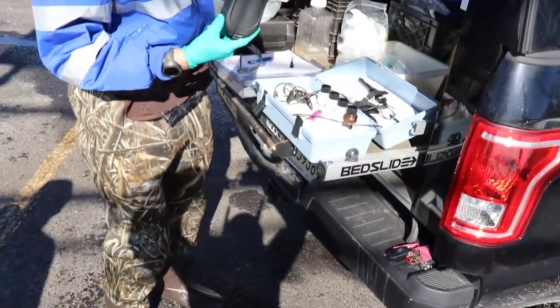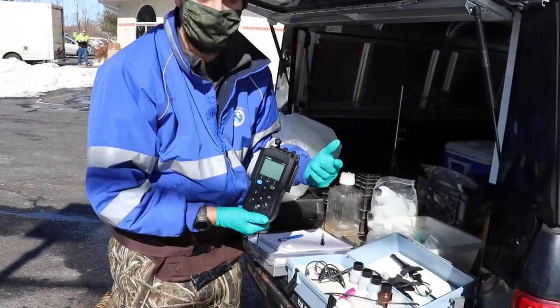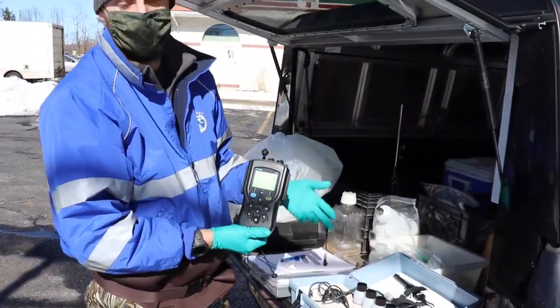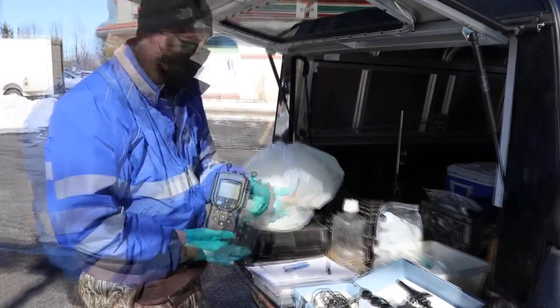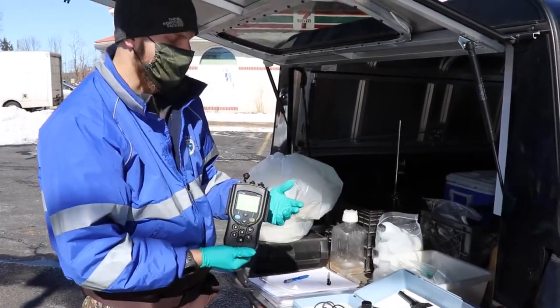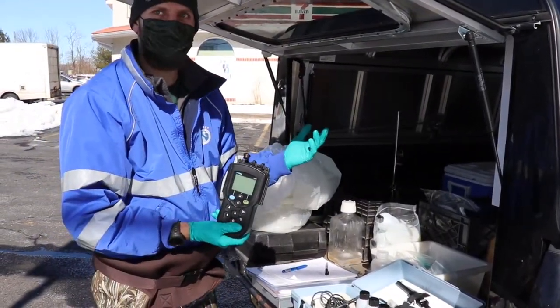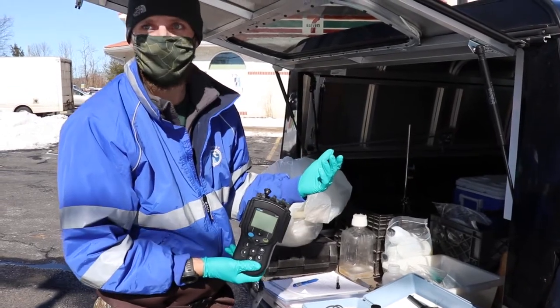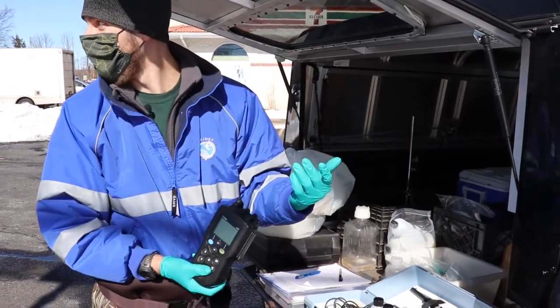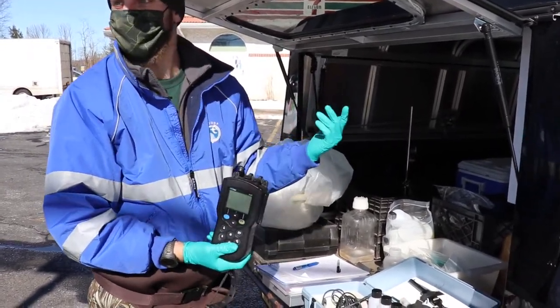We'll use the same meter to take other on-site measurements such as pH and specific conductivity. Specific conductivity is just a way of measuring essentially how salty the stream is. Road salt is a big influencer of that, so with the recent snowstorm that we had, I would expect probably a higher reading from that.